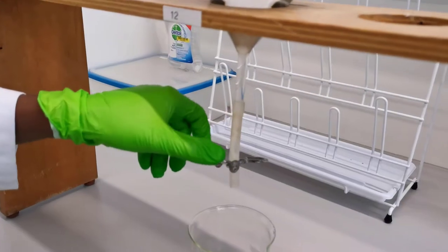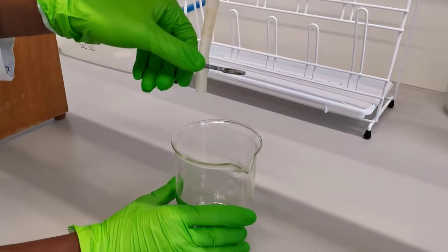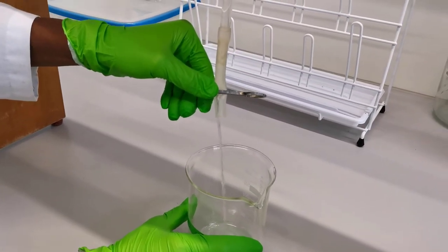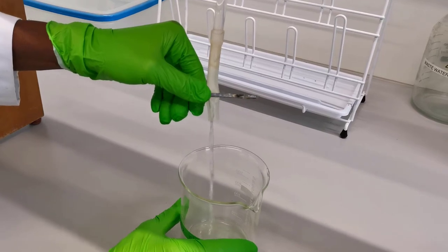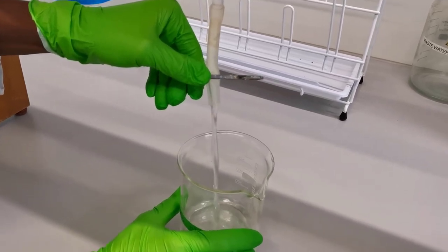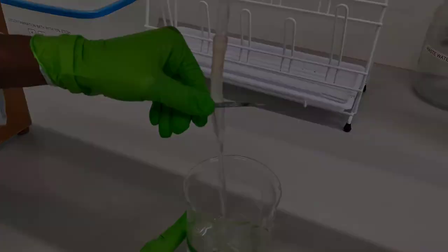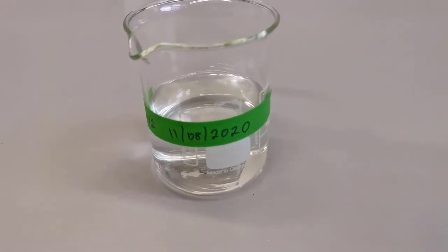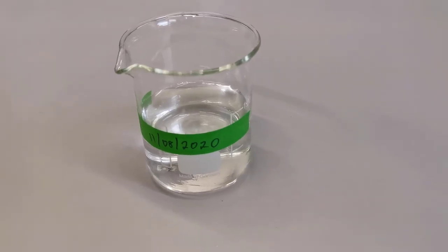The following day you can collect the nematode suspension in a beaker by simply releasing the clamp and letting the extract flow into the beaker. It is also okay if you had left your sample for more than 24 hours. This is the final nematode extract ready to be used for further analysis.